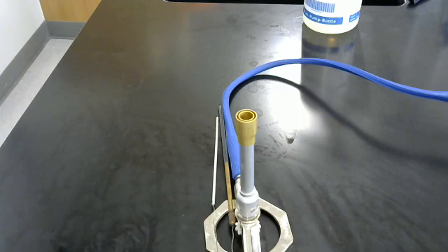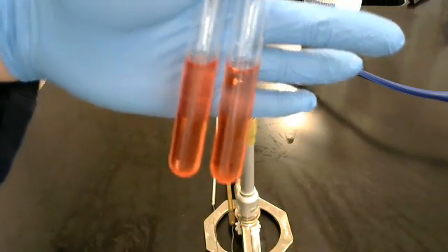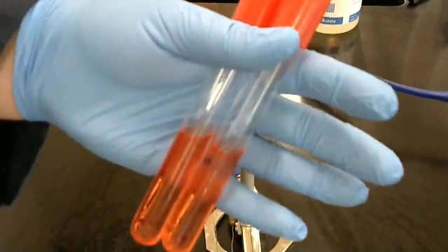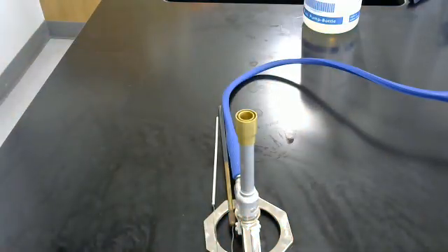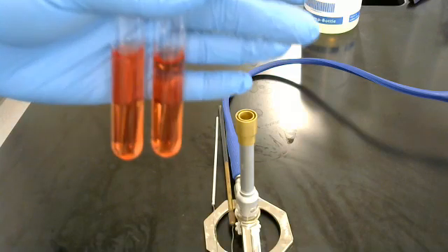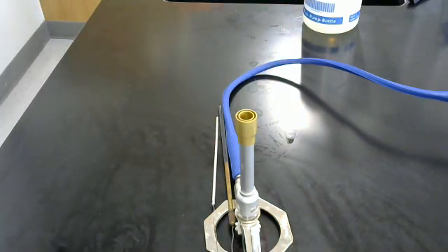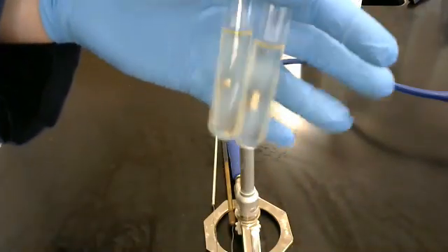We have these guys, these are broths. Specifically, they are fermentation tubes. I don't have any TSB broth on me and I figured this would work just as well. And for this, we are going to need to do shakes. And then we have this here, our last one, which is nutrient gelatin. We are going to do some stabs.